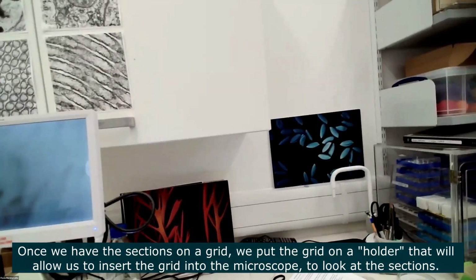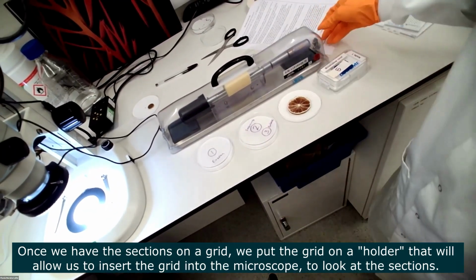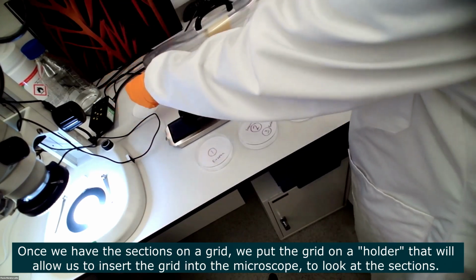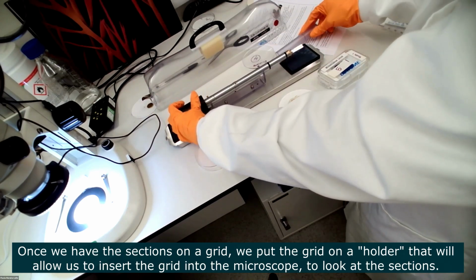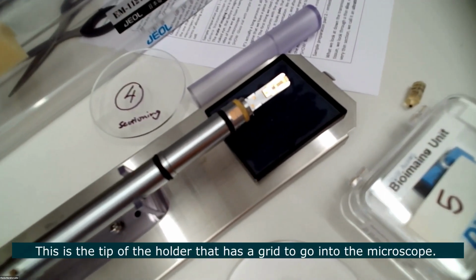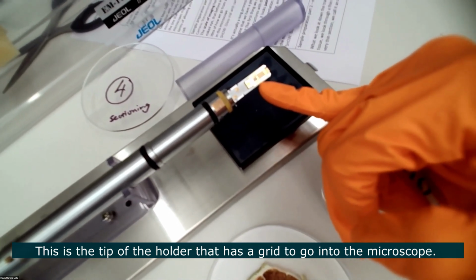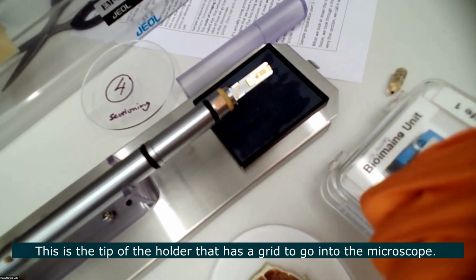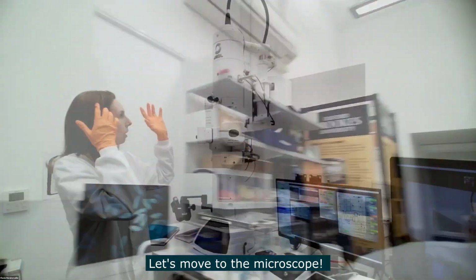Once we have the section on a grid, we put the grid on a holder. And this holder will allow us to put the section on the microscope, okay? So this is the tip of the holder that will go into the microscope. This is the sample holder that we will use to insert the sample on the microscope. At the very tip here, there is a little grid. So let's move to the microscope.